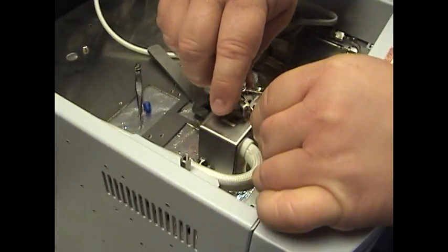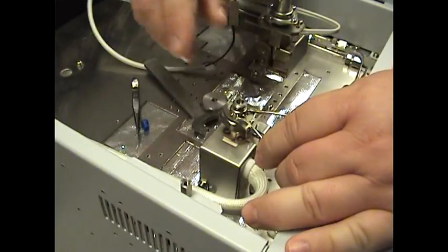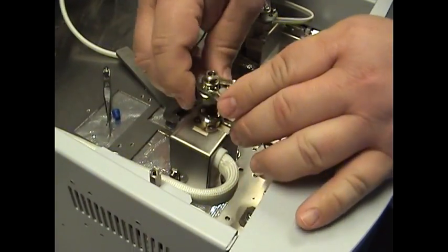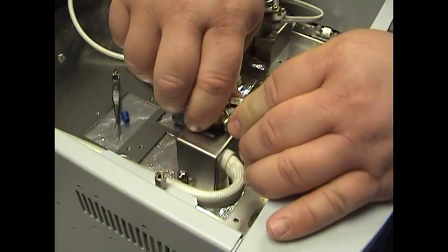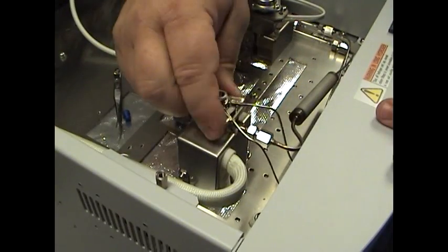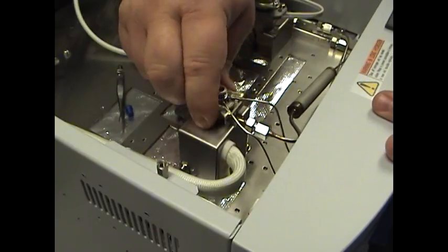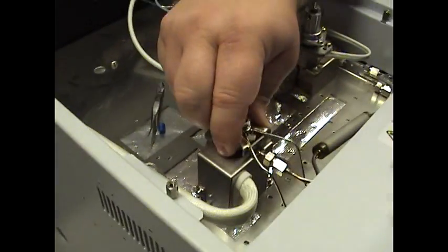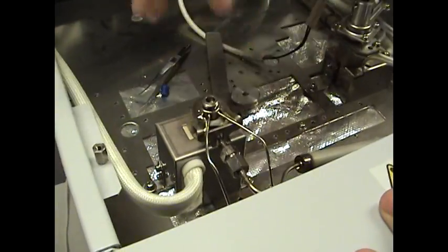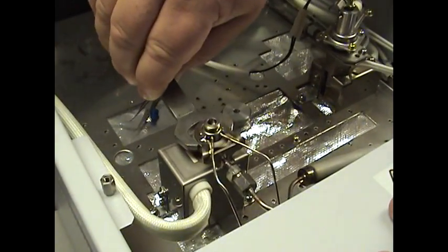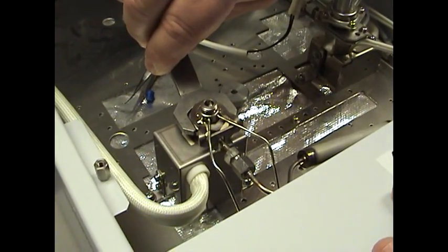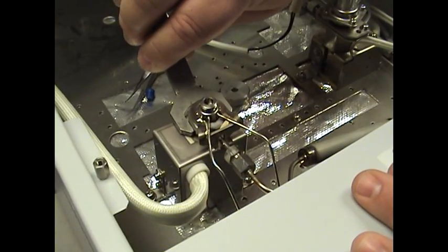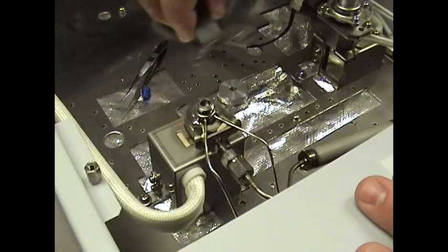So if that's done, we're going to go ahead and put the cover back on. Line this up evenly and it's very important to have this flush. You don't want to have it angled forward or back or side to side. The knurled nut should go on top of the fitting very smoothly as such. Go ahead and screw that down, finger tight, and it should screw on very easily. Take your wrench and just snug it down. You do not want to crank on that too tight. Just snug. If you crank it on too tight and you hear a cracking sound, that means it's too tight and you broke the liner. You need to clean it out and redo it.